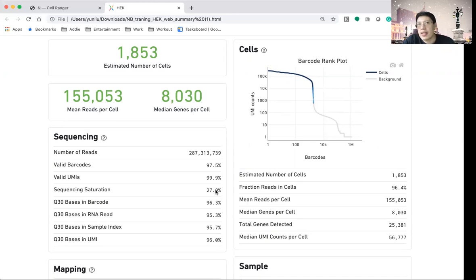This is a number that, of course, ranges from 0 to 100%. The larger this number is, the more your system is being saturated, which means if you sequence more of the same library, you wouldn't be able to identify more genes for the cell. Normally, we want to control this level at about 30%-ish, and that would be a good experiment. You don't want this number to be too low, because if you sequence more you're going to get more information, or too high, which indicates that you waste a lot of sequencing reads already.